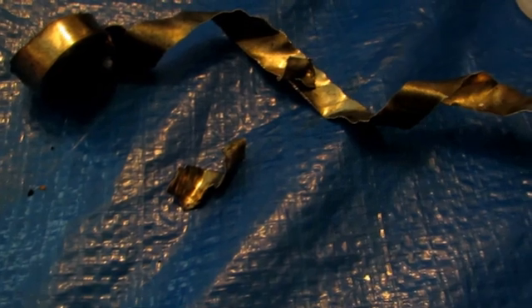I actually uncoiled the whole outside of zinc because it turns out that in between the manganese dioxide and the zinc there was actually a thin paper layer. So to avoid the hassle of trying to remove all that manganese dioxide, I just simply took the zinc metal and pried it off with some pliers. This zinc metal has a very low melting point — zinc melts at only about 420 degrees Celsius, so we'll be able to easily melt it down with a blowtorch.